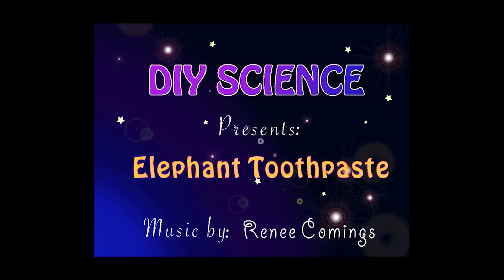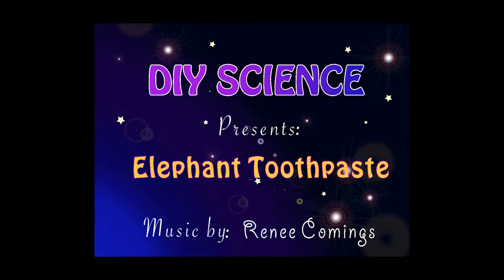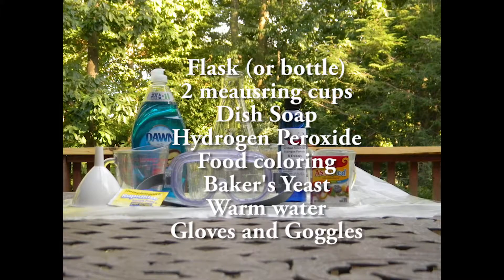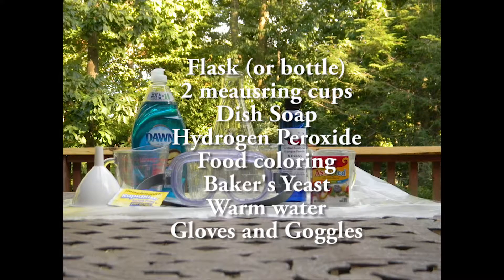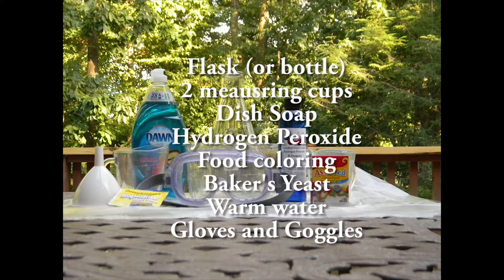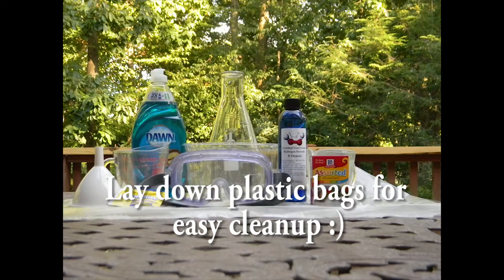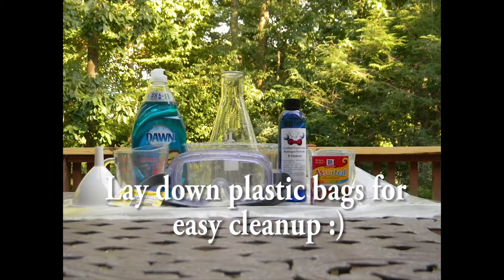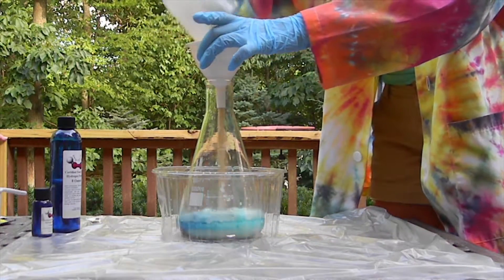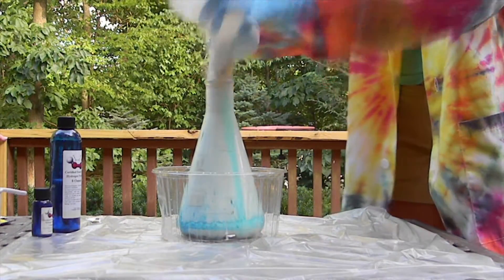Hi everyone! In this video, I'll be demonstrating and explaining the science behind a classic experiment, elephant toothpaste. If you're just here for a big backyard reaction, then this probably isn't the video for you.